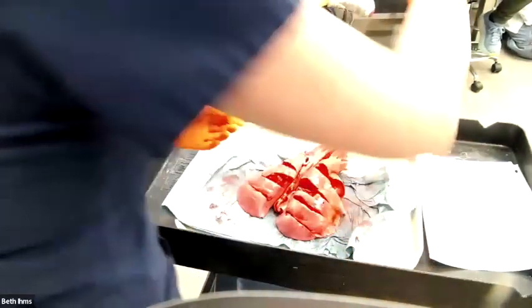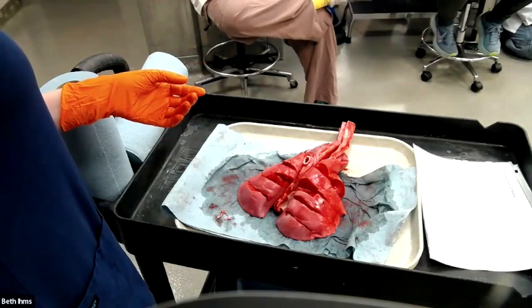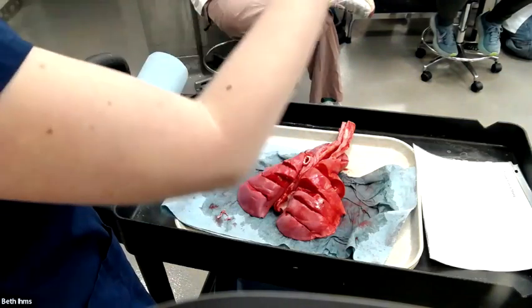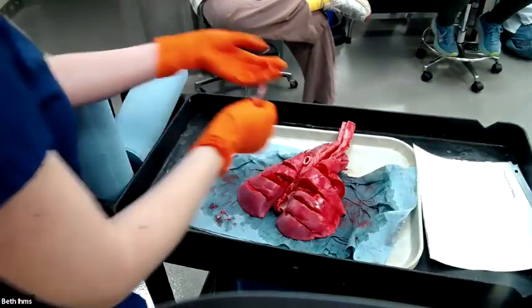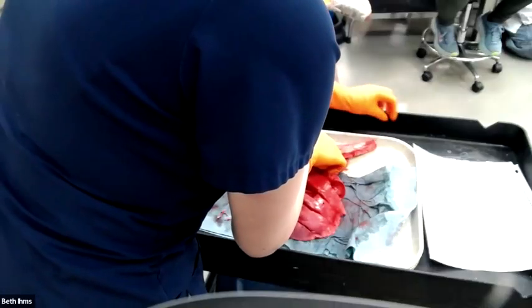And this is fallen out now, but this was in the trachea. Did everybody see that? How did you describe this? It's kind of wormy. It's stringy, white. It's pretty soft and friable. And it was just kind of laying in the tracheal lumen like that. We'll put it back for the next class. Do you even know what that is?